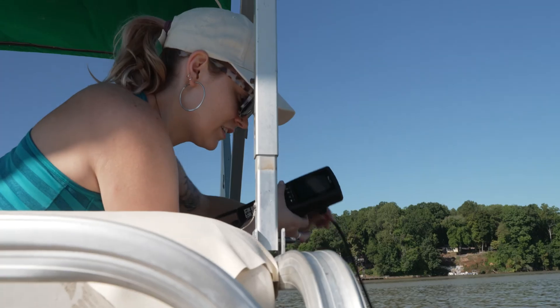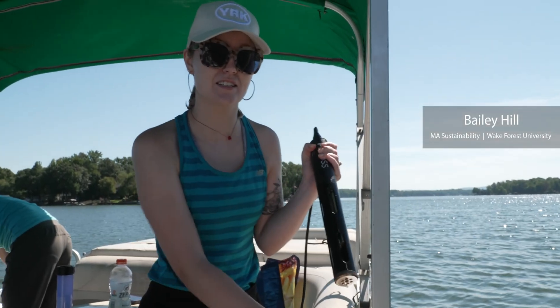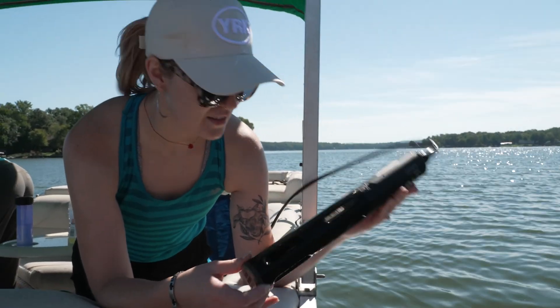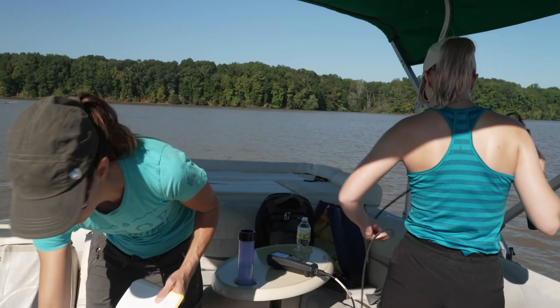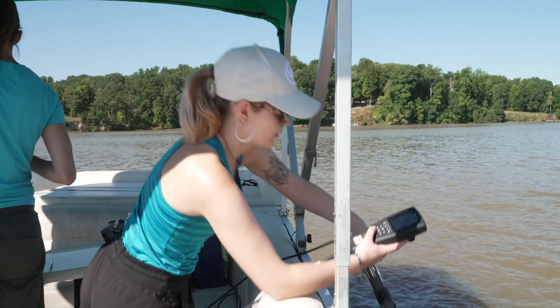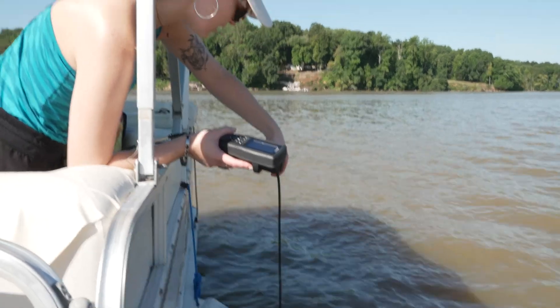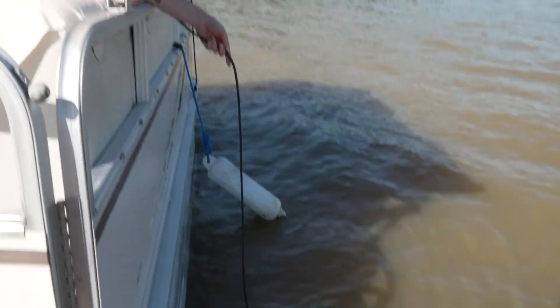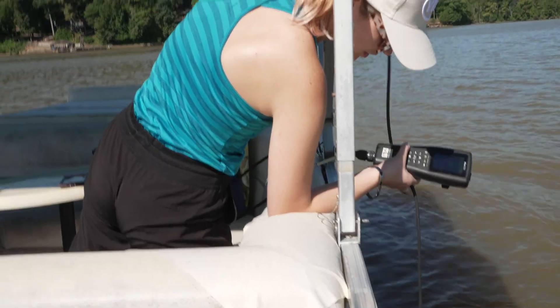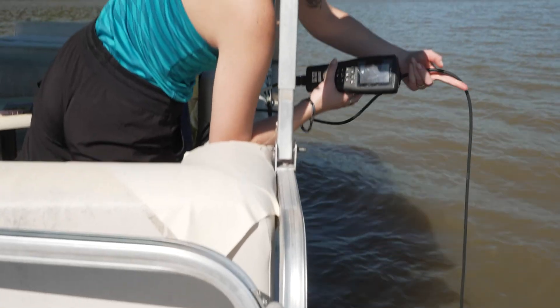This is a YSI Sonde reader. Inside this case we have sensors that read the level of pH, chlorophyll, temperature, and turbidity, but right now we're just using it to read chlorophyll. We take a reading at surface level — it's reading chlorophyll at 9.45 — and then we have it taped off at the two-meter mark. If the water is deep enough, we'll get a reading as far as it'll go.